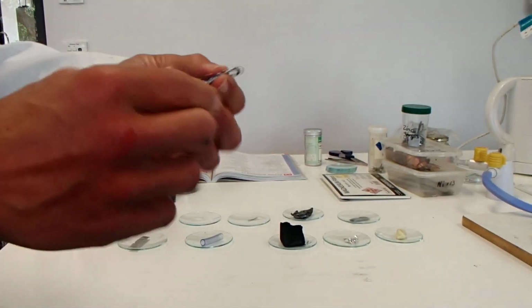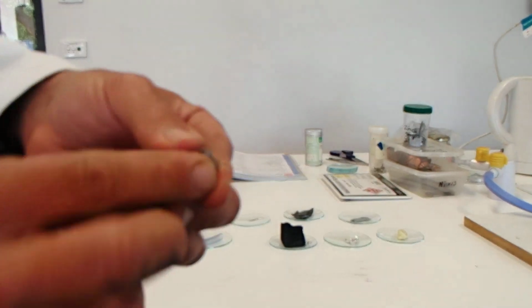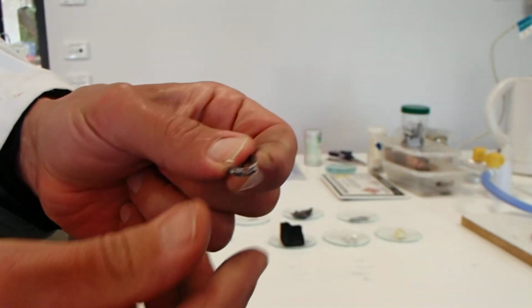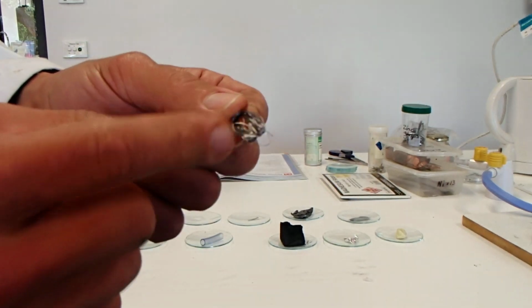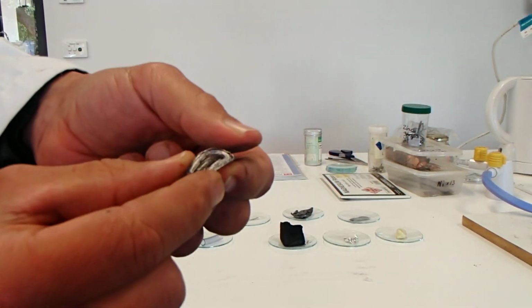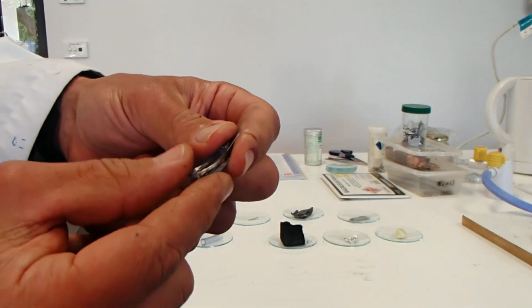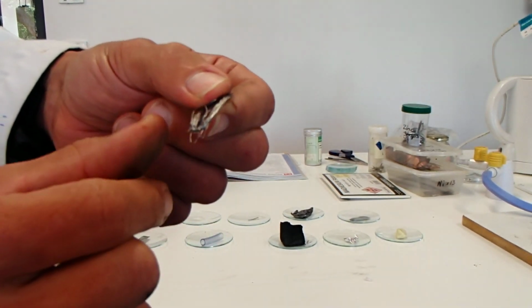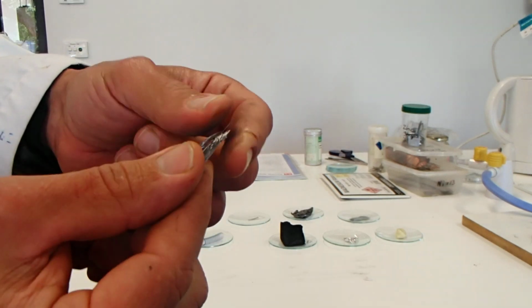And last of all, this is a pure sample of iron wire. It's the only sample that we have, so we don't have a flat sheet of iron. So that's the iron wire there. Again, a little bit grey, similar to the lead, sort of a light to dark grey, quite shiny. Quite heavy for what it is. This is iron wire. Shiny, light to dark grey, quite smooth, quite heavy.